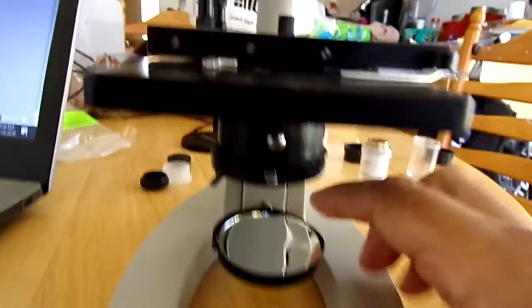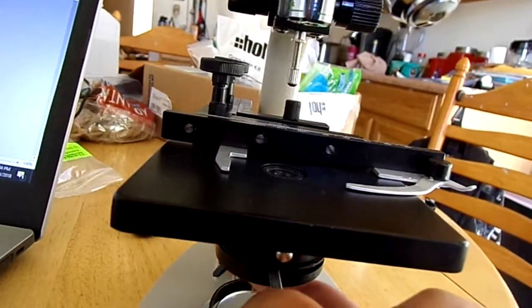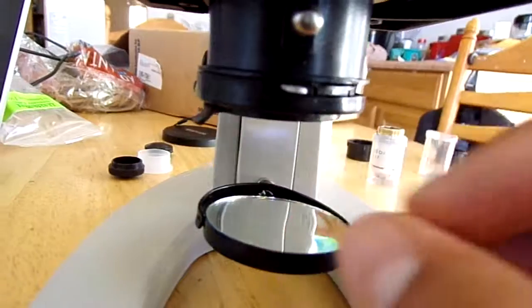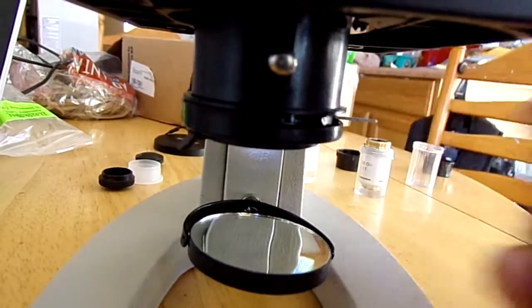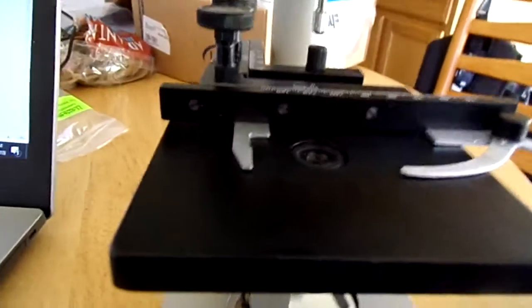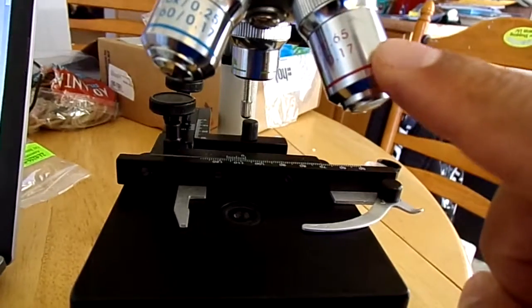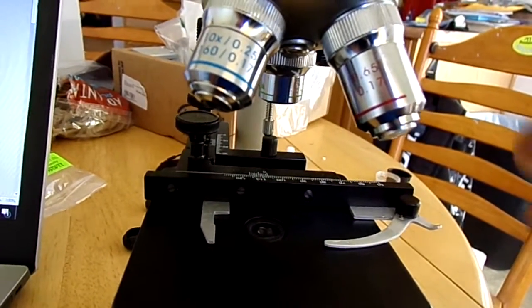The illuminator is our light source that comes through here into the diaphragm. The diaphragm down there controls the amount of light. This position means all the light will open up, and then this will essentially turn off the light coming through our lens that we can view. Sometimes the darker it is, the easier it is, especially on a high power view. It allows us to see a little deeper when we have a darker light.